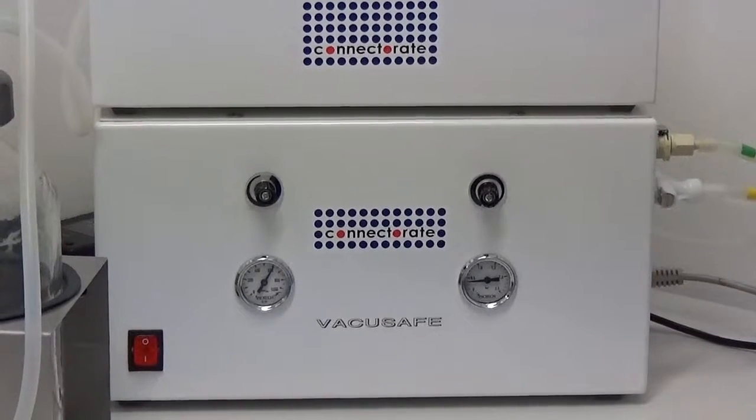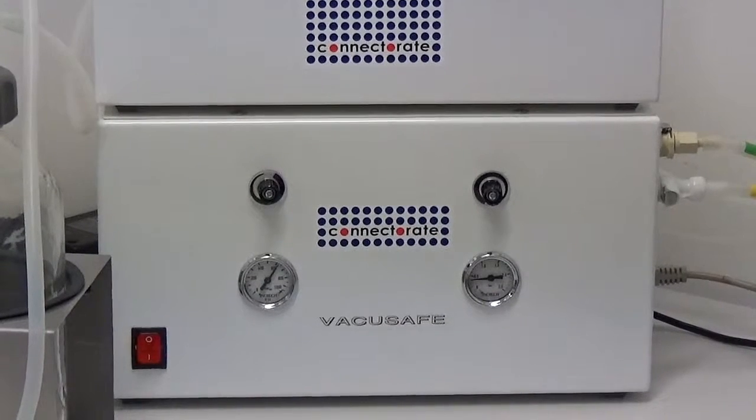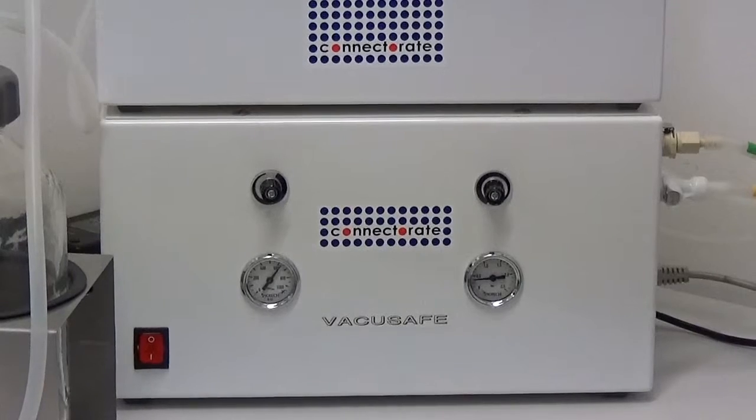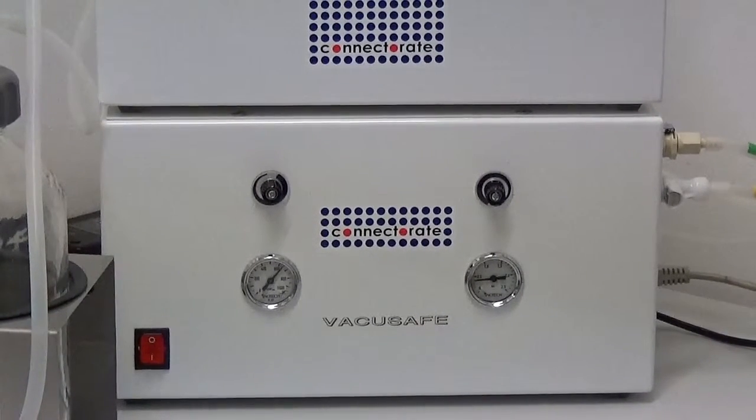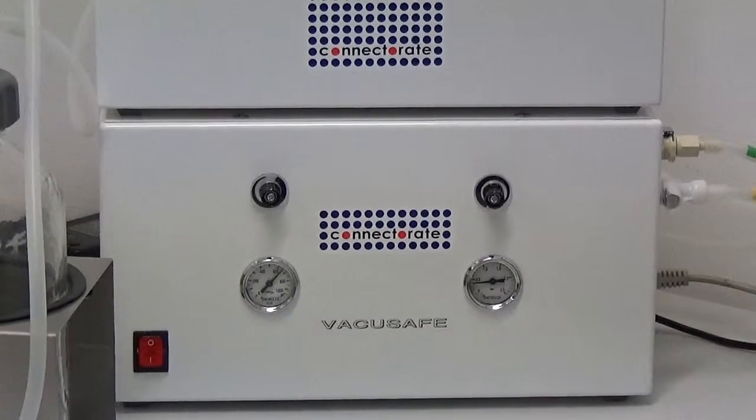For a successful harvesting operation, it is of key importance to start aspiration of assay solution only after the vacuum pump has reached the set level.